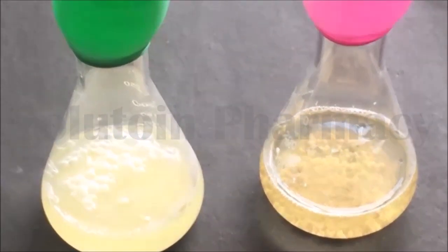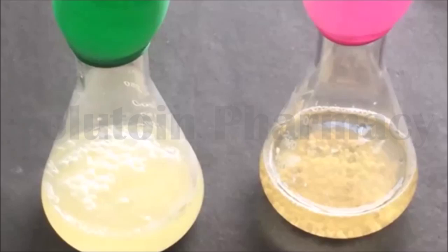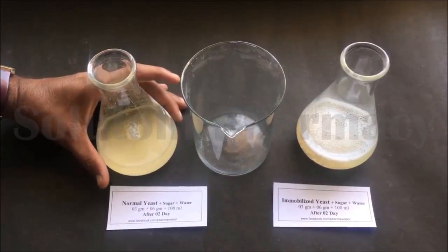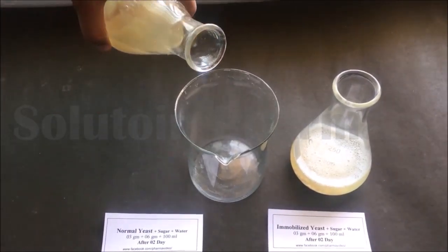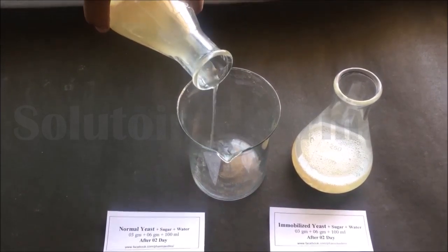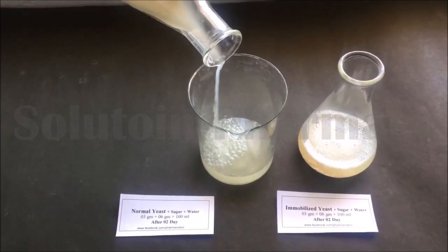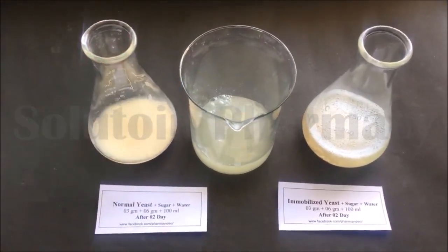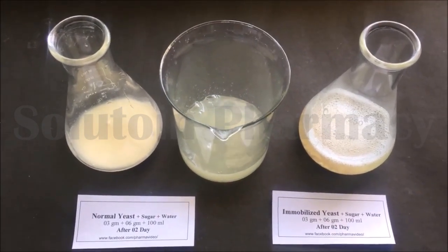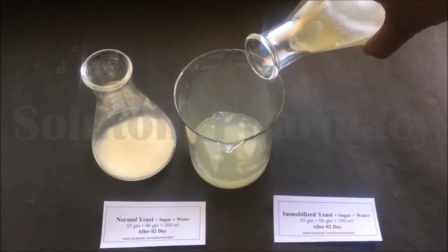If you look at the bottom of each conical flask, the immobilized yeast cells are still in intact form, but unimmobilized yeast cells get mixed into the water. You can clearly see this after decanting the liquid. Decant the liquid from the conical flask containing unimmobilized yeast cells into a beaker — you can see that the yeast cells are completely mixed with the liquid and are not easy to recover.